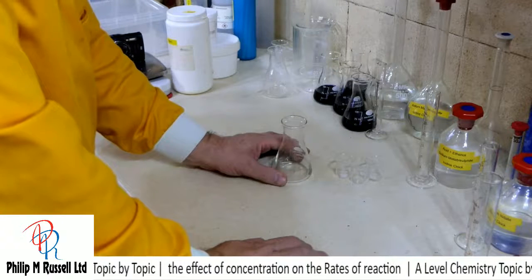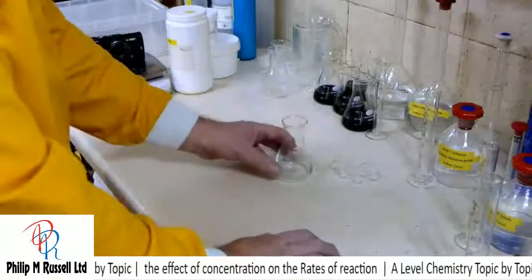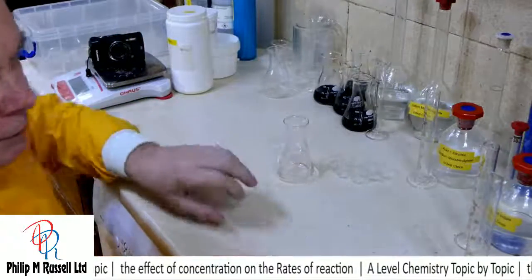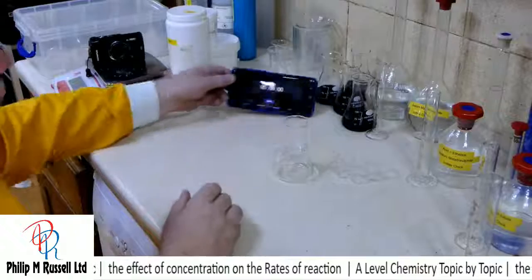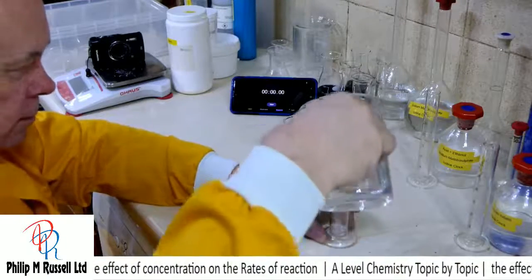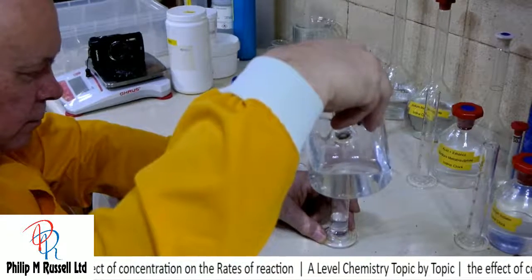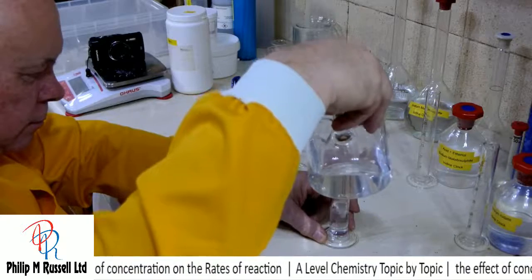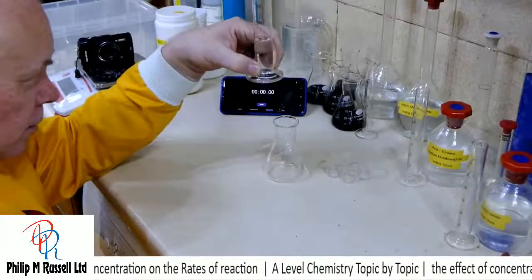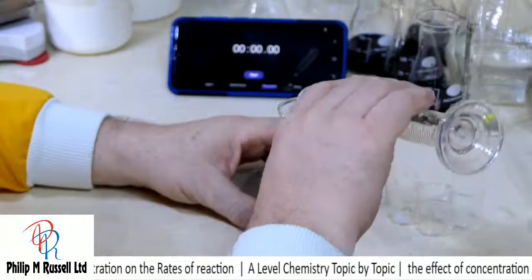So let's start with something nice and easy. We're going to start off with just 20 mils of water in here. So let's start with the 20 mils of water. I'll put the clock at the back. We've already got some idea of how long this is going to take. But this time I'm going to try and be a little bit more accurate in what I'm doing.